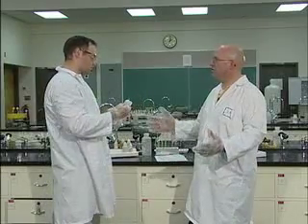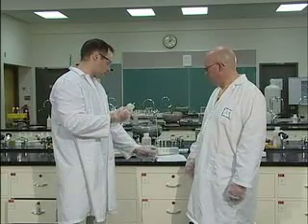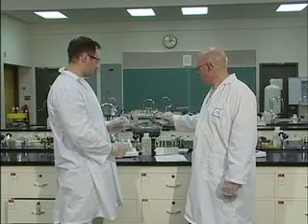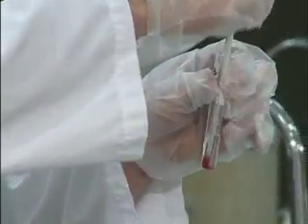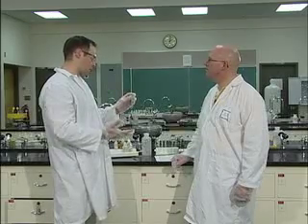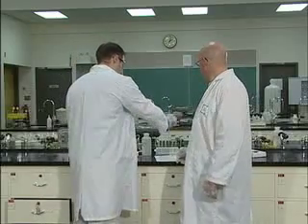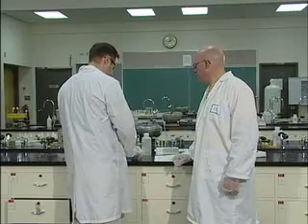Now, is it going to get warm too? Well, first of all, you're going to measure and record the temperature of this solution. I'm going to take the thermometer out, rinse it with distilled water and dry it, and we're going to stick it into our hydrochloric acid. We'll notice that the hydrochloric acid is roughly around room temperature. Now we're going to remove the thermometer and place it in our test tube rack, because you'll notice what's going to happen here.